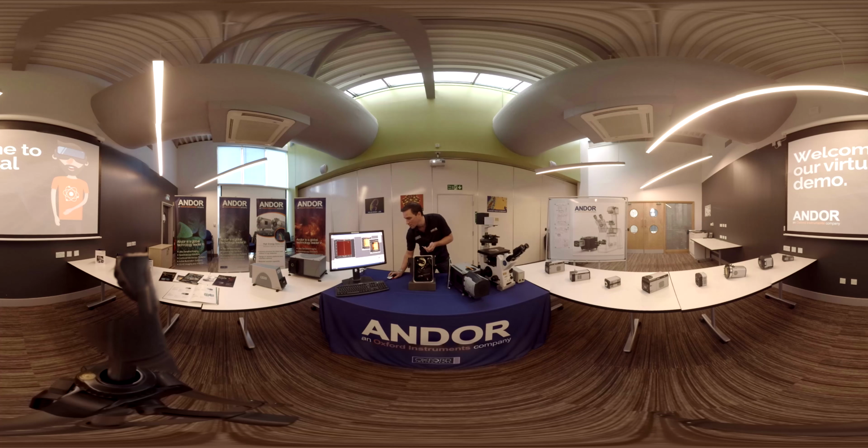You can click on it to cycle through those. The filter wheel, you can choose a different filter, up to 6. Grating, just click on the grating you want. Focus mirror, drag it or enter in a different value. Or if you have a spectral peak in the middle of your acquisition, you can click autofocus and the system will automatically find the best focus for you.